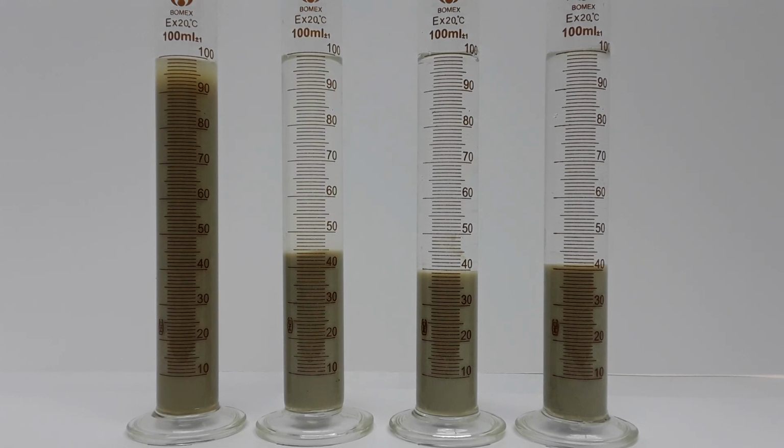Now looking at just seawater, we see that the potassium chloride substitute actually did less to prevent clay swelling than seawater simply by itself, with seawater swelling the bentonite clay to just 3.3 times its original volume. PIC safe seawater product contains clay stabilizing additives, but even with these stabilizers, we see that the seawater treated with safe seawater swelled more or less the same as seawater on its own.